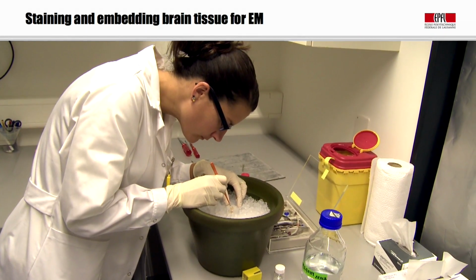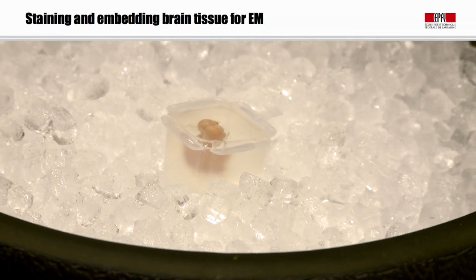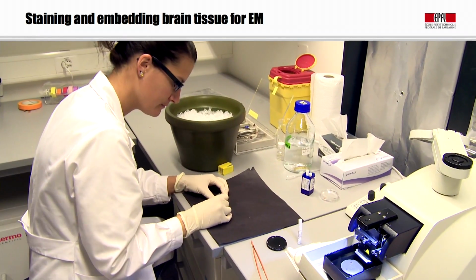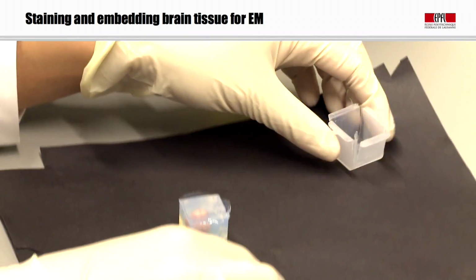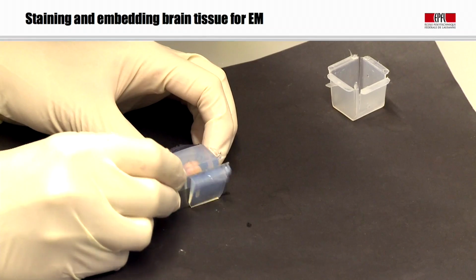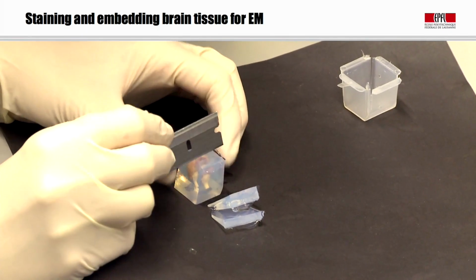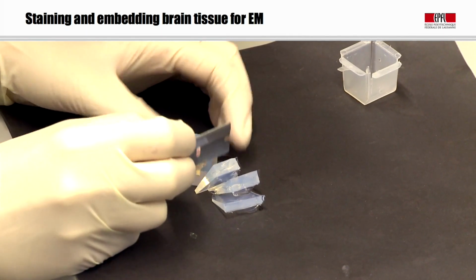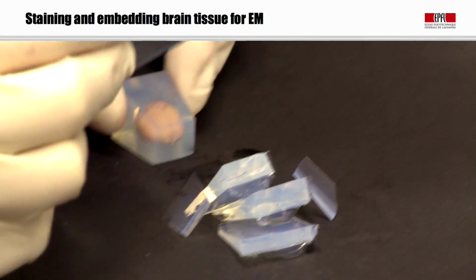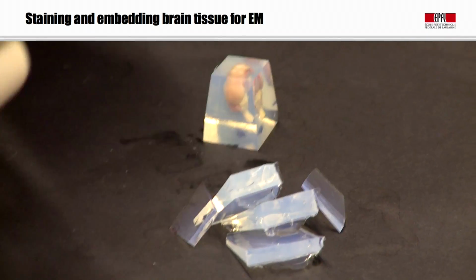And this agarose allows us then to just position it at the right angle in the mold. This agarose is then solidified on ice, and after a few minutes we can take it out of the mold and then cut away the excess agarose so we can get better access to the brain. And once this block is of an ideal size, it can be then stuck with superglue to a metal holder.